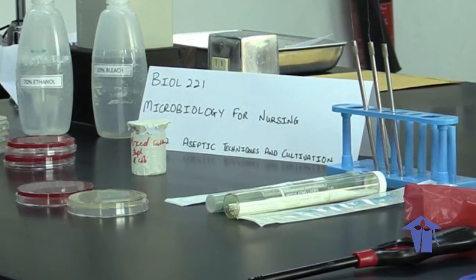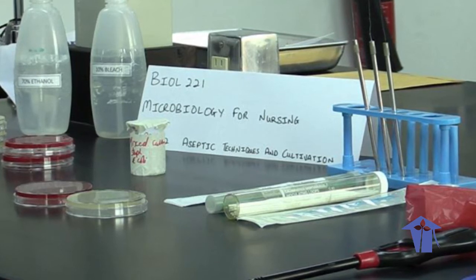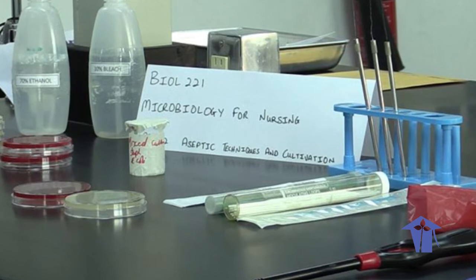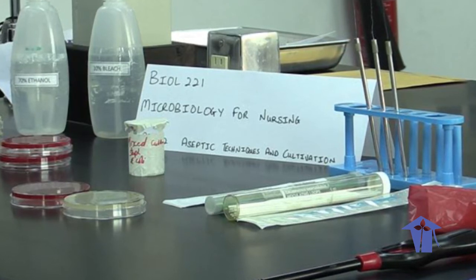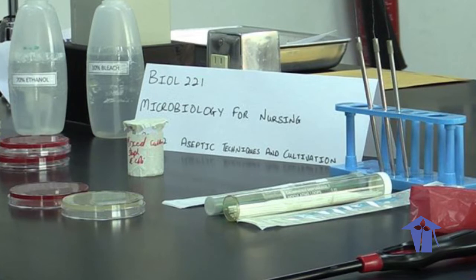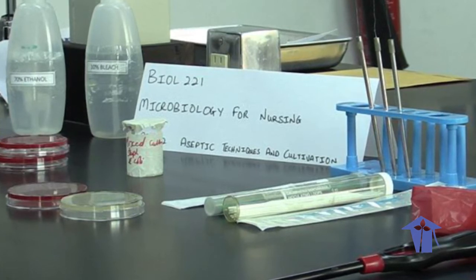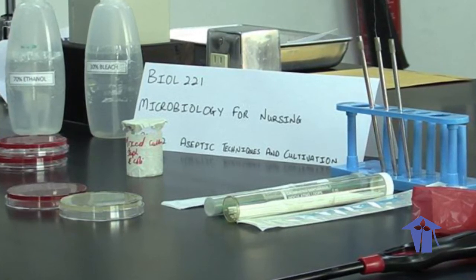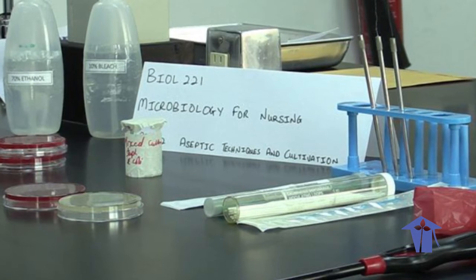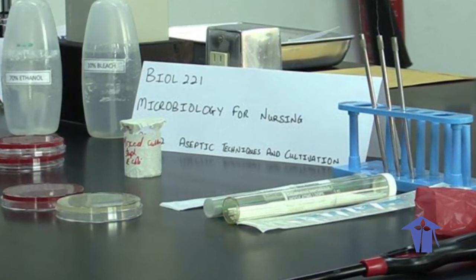In aseptic technique, we use what's known as media to grow our microorganisms. There are two main types of media we'll be discussing today: solid media, which is agar, and liquid media, which is broth. Microbes get their nutrients from the media we use — either the broth or the agar.